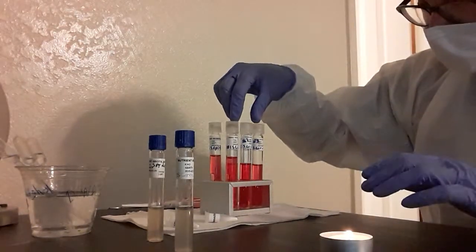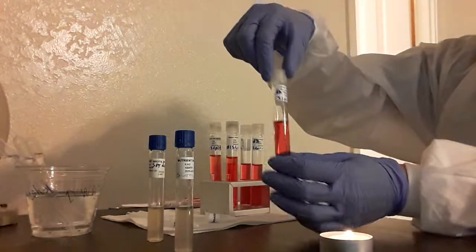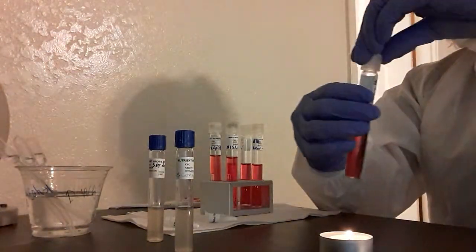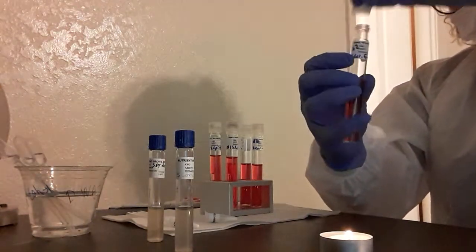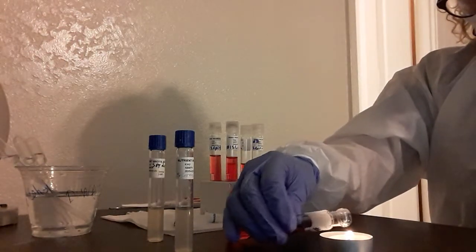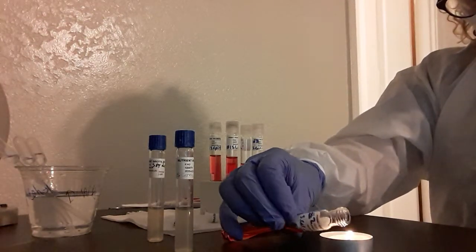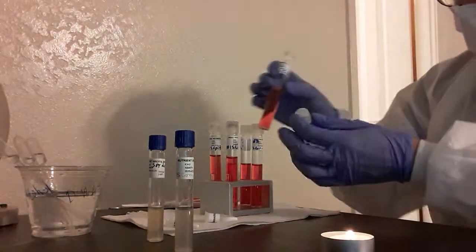So for this assignment, first we need to take our test tube and sterilize the top of this. All right, that should be good.